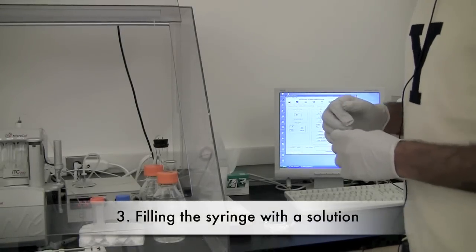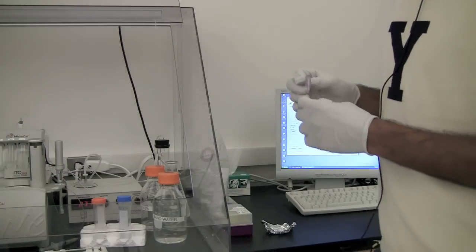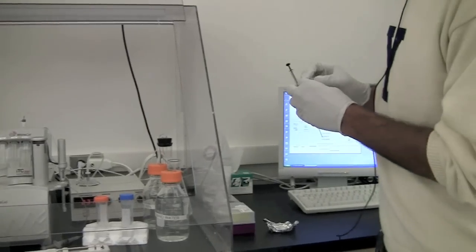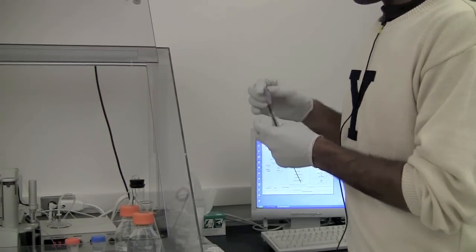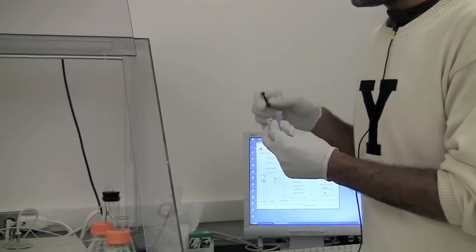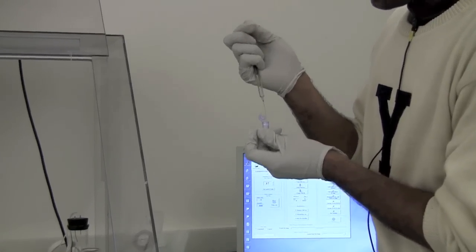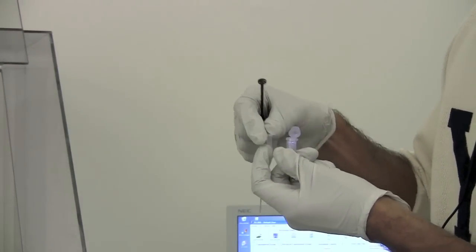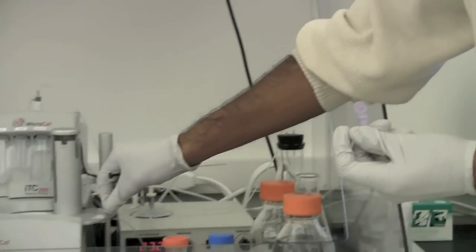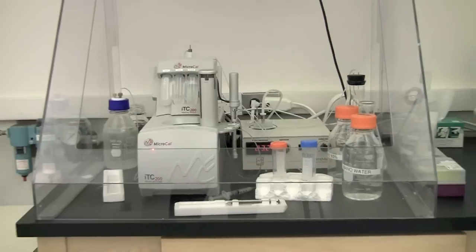The syringe washing is also done. The next step is to fill the solution in both the syringe and the cell. First, transfer the ligand solution from the larger tube to the smaller ITC-specific tubes — they are 200 microlitre volume. Transfer about 150 to 200 microlitres and put it at the loading position.